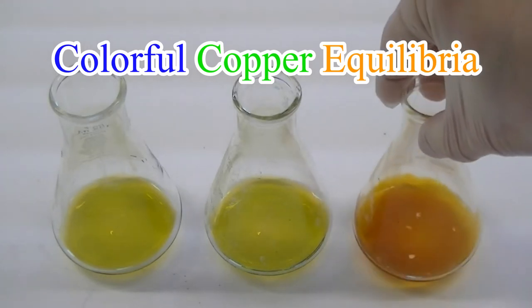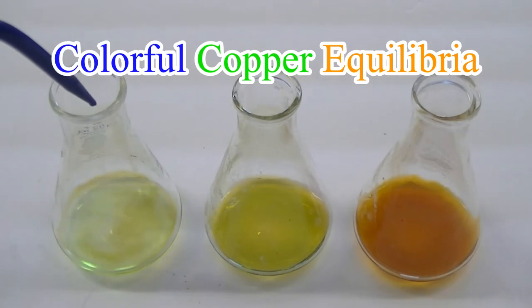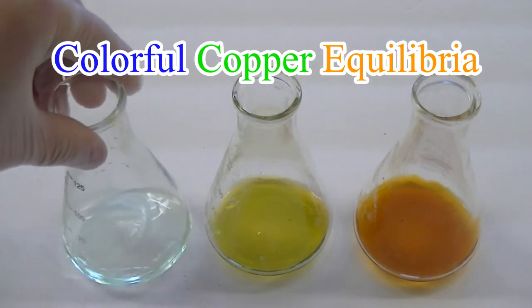In this video, you'll learn how to use solutions of copper-2-ion to demonstrate various principles of chemical equilibrium.